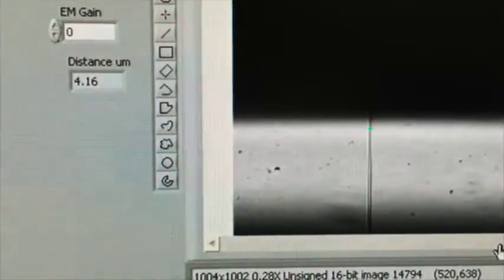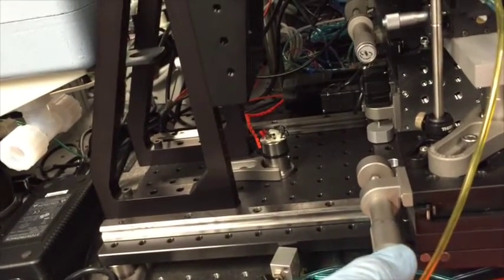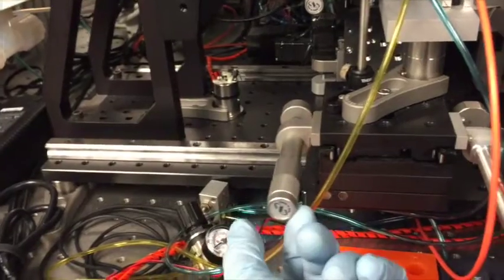And now I'm going to bring the edge of the blade into focus, and the way I do that is this forward knob up here. Here again is the cutter. So this is the knob that's near the cutter. I'm going to be moving this in the counterclockwise direction. And as I move it counterclockwise, the edge of the blade is going to come into focus. There it is, right about there. And once it comes into focus, I'm going to crank this one more time 180 degrees.